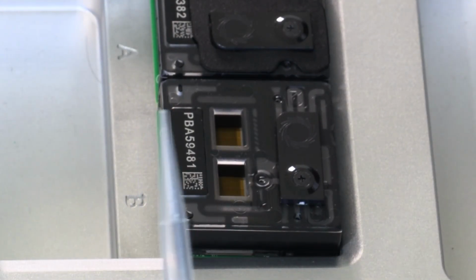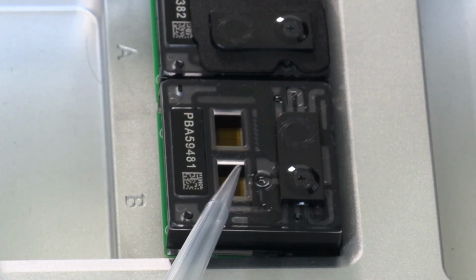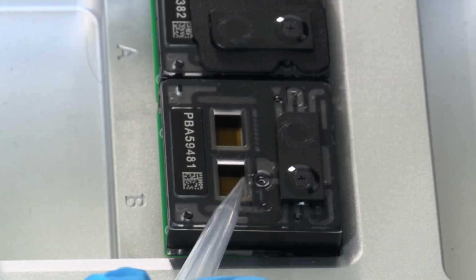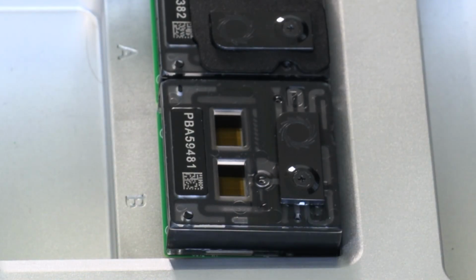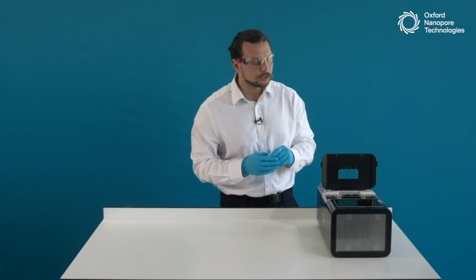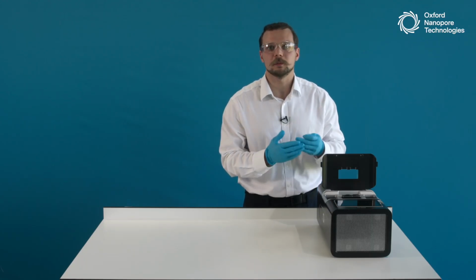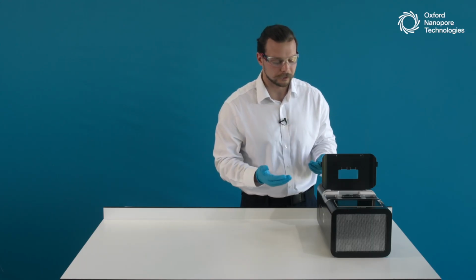The main part of the flow cell, where all the sequencing nanopores are, where all the channels are, is the flow cell array that is visible on the flow cell through these two rectangular windows. It is located actually slightly deeper below the flow cell. This is the main part and the most sensitive part of the flow cell, so we do not want to interact with it directly, and it is actually inaccessible to the user to pipette things onto it directly.